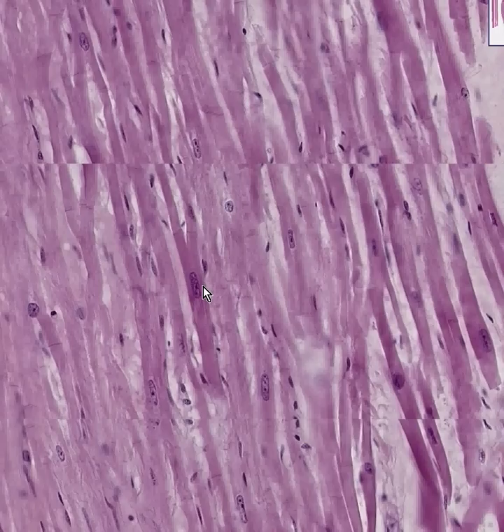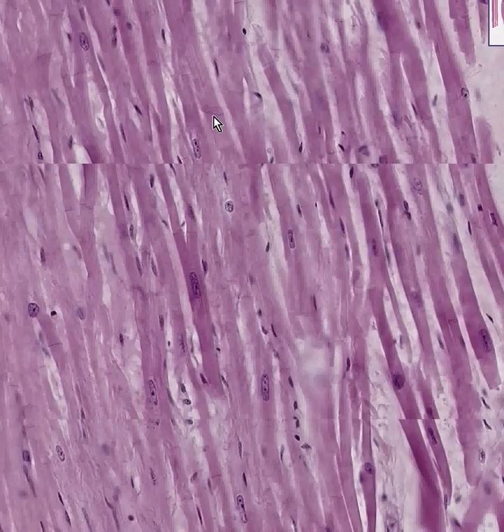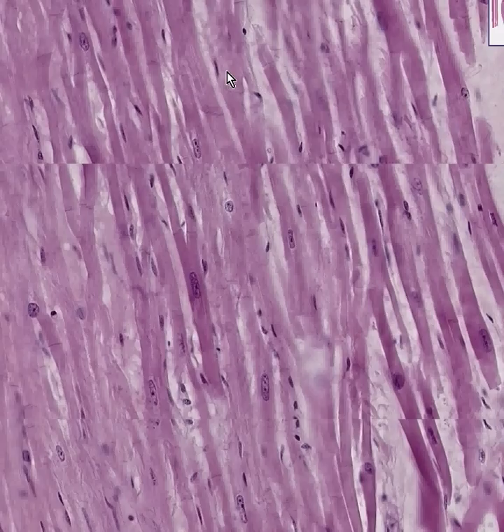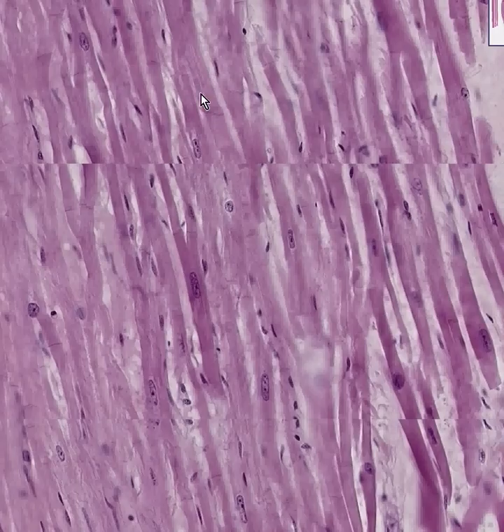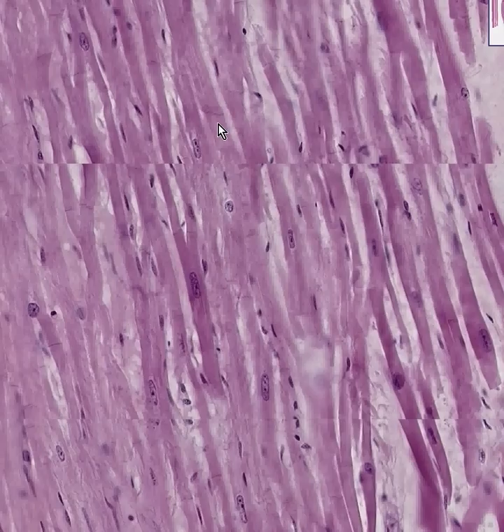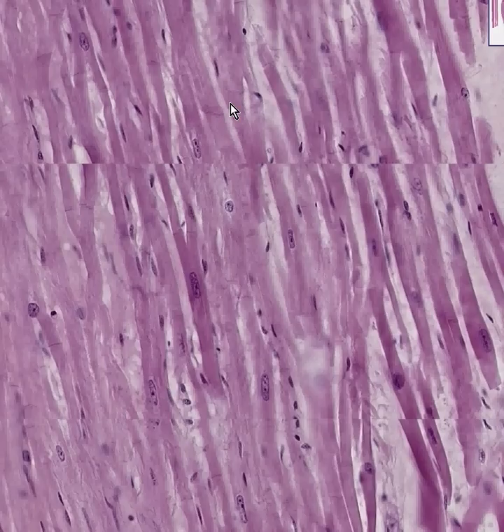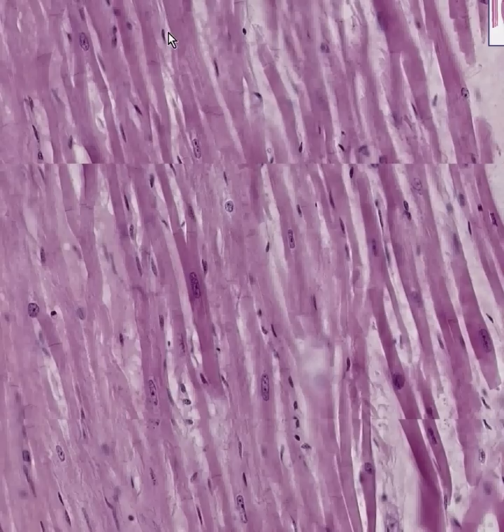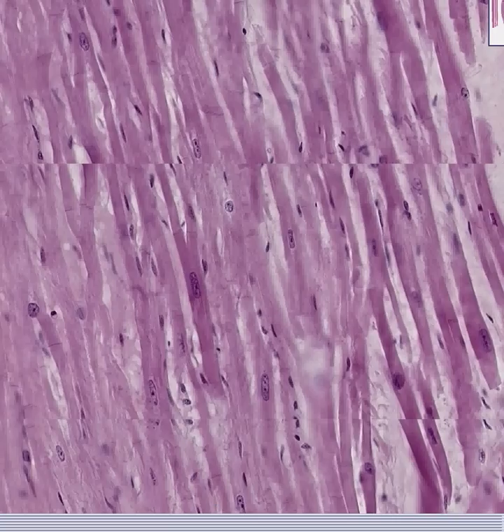Cardiac muscle is also striated — not as neatly as skeletal muscle — but it has the nuclei in the middle of the fiber, it has intercalated discs, and the fibers branch to connect with adjacent fibers because the method of contraction is not linear but in multiple dimensions. Also, the fiber is not quite as thick as the skeletal voluntary striated fiber. So there we are — all three types of muscle on one nice slide, and there is no possible way you could ever confuse skeletal from cardiac muscle for the rest of your life.